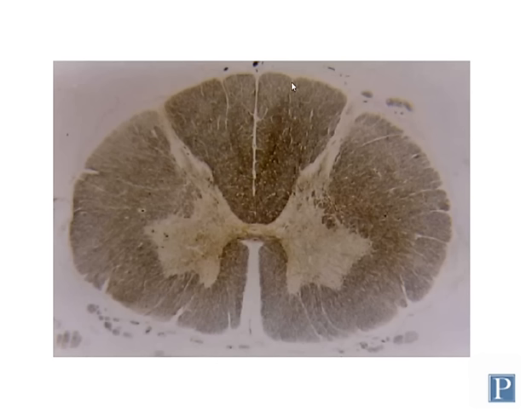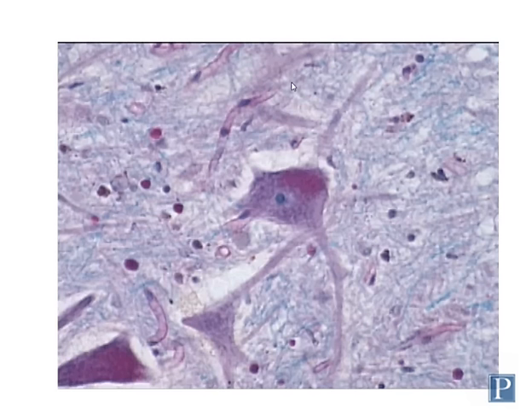Let's take a closer look at some of the actual cell bodies of neurons within the ventral horn. And the ventral horn contains multipolar neurons of varying sizes. The largest are these large multipolar motor neurons. By multipolar we mean they have a single axon and multiple dendrites. So this is one type of multipolar neuron, but pyramidal neurons are another example of multipolar neurons that are found in the cerebrum.